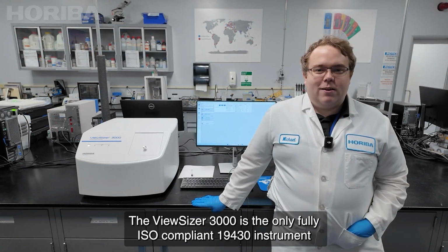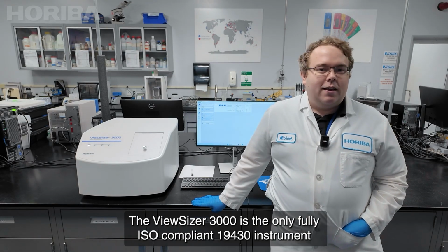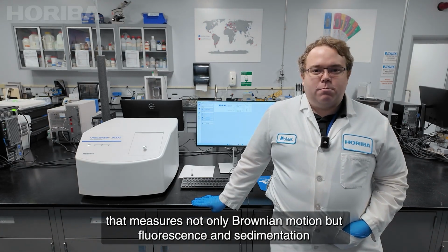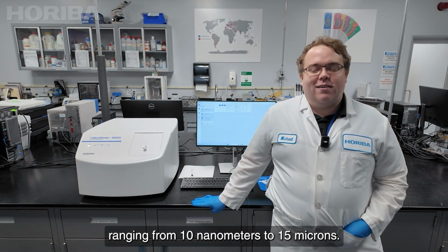The ViewSizer 3000 is the only fully ISO-compliant 19430 instrument that measures not only Brownian motion, but fluorescence and sedimentation, ranging from 10 nanometers to 15 microns.